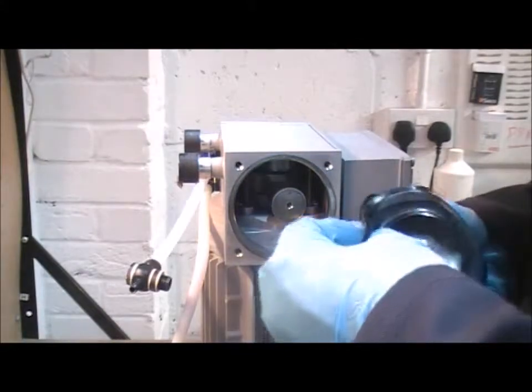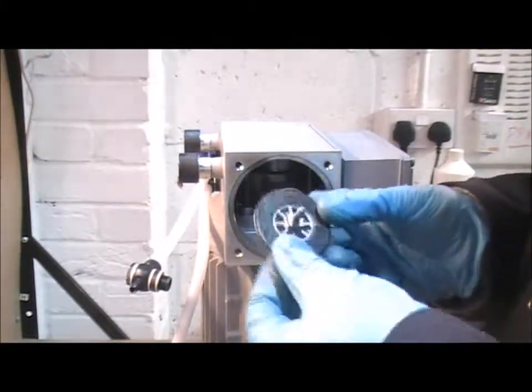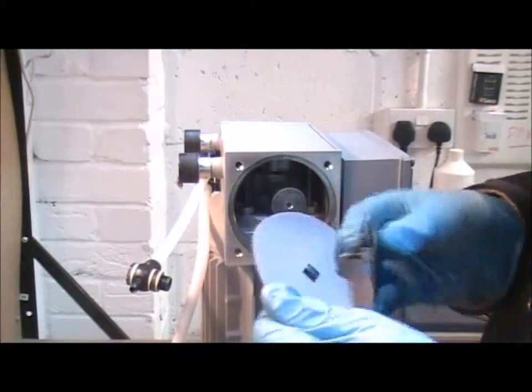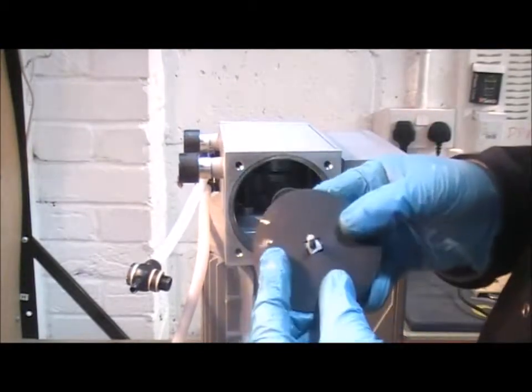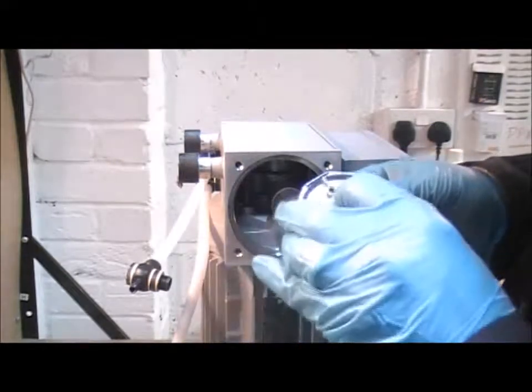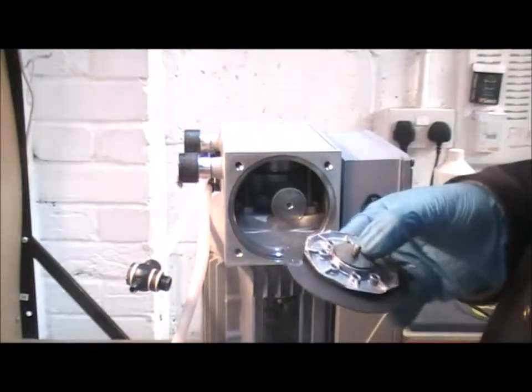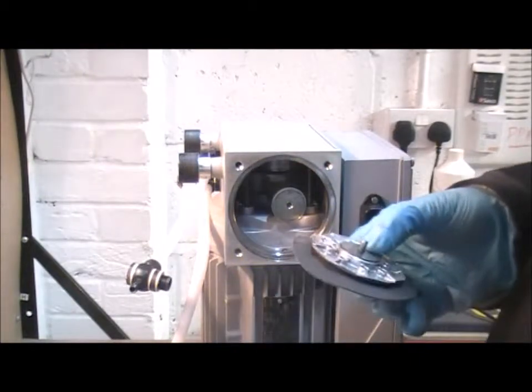And then the backing plate and those shims will come away, and the diaphragm peels off from the main holding plate. And then the new diaphragm, trying to keep everything clean, put it together. There's a square section in the center, make sure that's securely located. Then add the backing plate, which again locks onto that square section, and then make sure that you replace all those shims that came out.